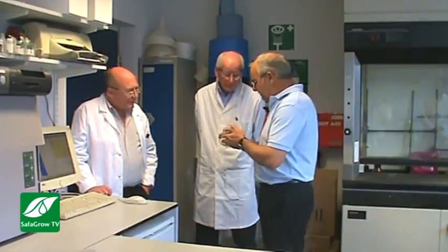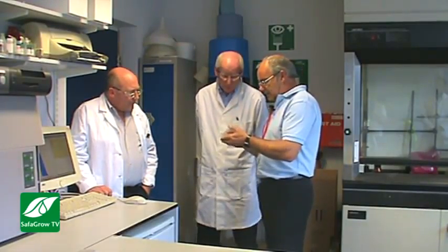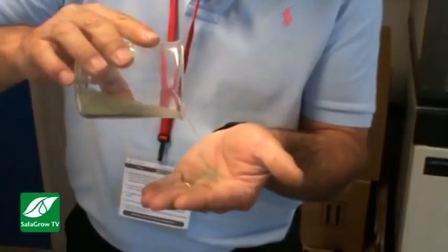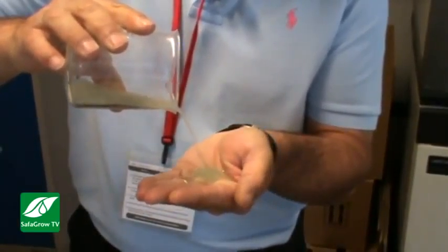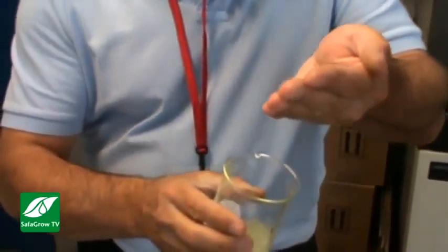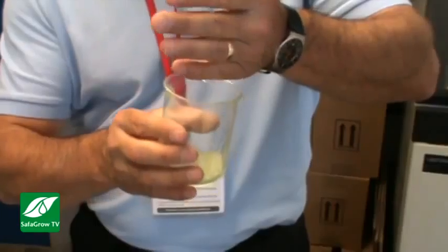John, part of what we'll see later, I guess, because you've offered us a trip round to have a look at some of the machinery. Here is a beaker of what looks to me to be fairly coarse sugar or glass balls, very tiny glass balls. Yeah, they are soda glass beads. They are nominally 1.5 millimetre in diameter. Okay. And they go into our mills, and we'll see those a bit later.